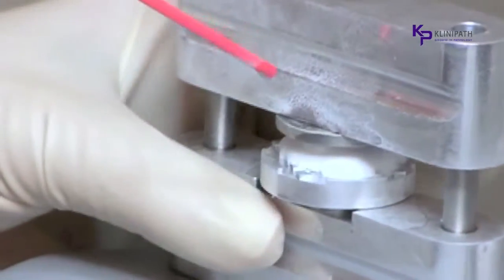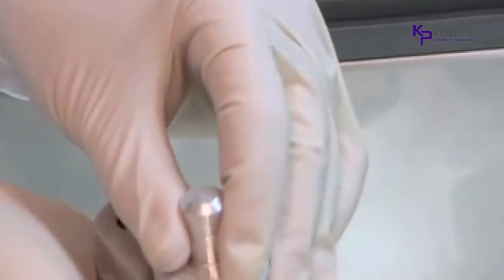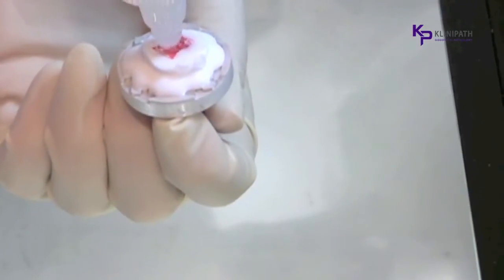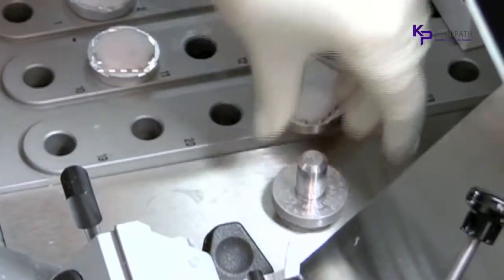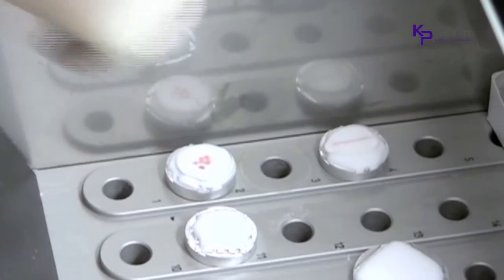The design of the Cryoembedder reduces the length of the specimen. It prevents the need to make major adjustments of the block to be in alignment with the blade. It's best to be cautious and apply a thin buffer layer to prevent the blade from damaging the specimen. This can be done on larger or darker specimens by putting a drop of embedding medium over the bare tissue and placing it on the floor of the cryostat. With smaller specimens that may be difficult to see, simply smooth a thin layer over the bare tissue to provide a protective layer, yet still see the shape of the specimen.